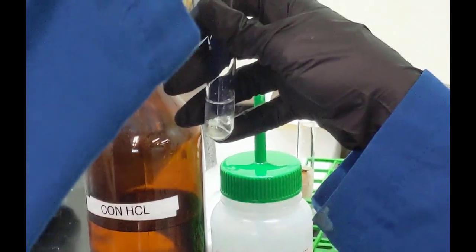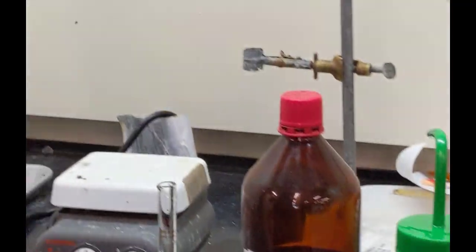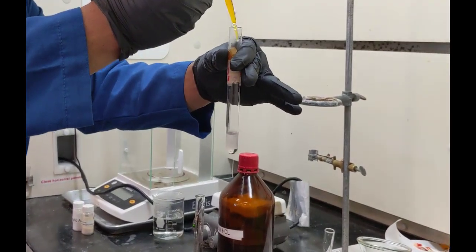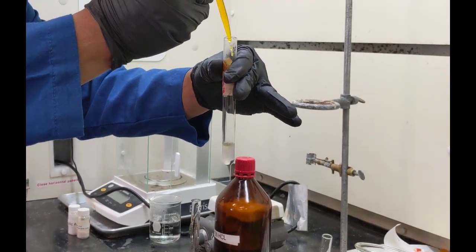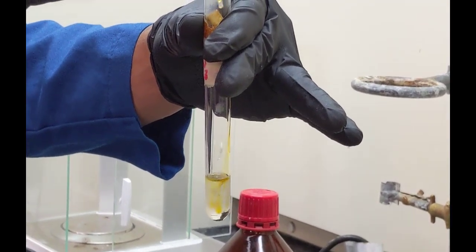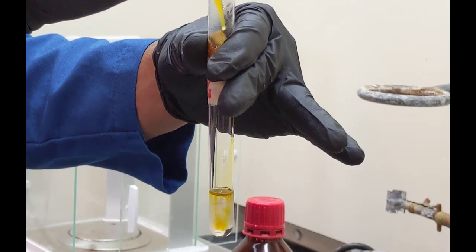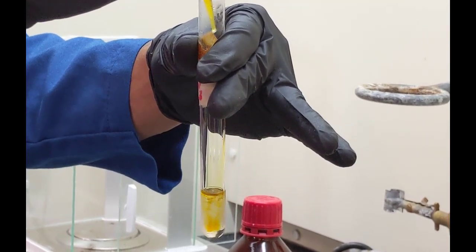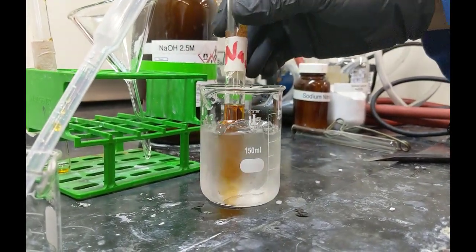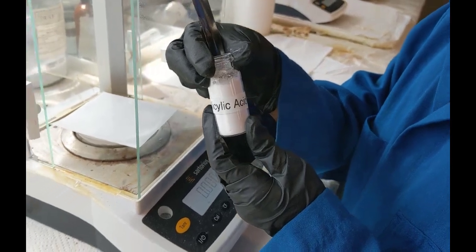And so that ice water hydrochloric acid solution is then going to be mixed in with the mixture of the aminobenzene derivative and sodium carbonate solution, and they're adding it dropwise, right? So that yellow solution, that's your aminobenzene sulfonic acid, sodium carbonate, and sodium nitrite all mixed together, right? And so they're adding it dropwise to the hydrochloric acid, and they are going to now put that entire mixture together in the test tube in an ice bath.